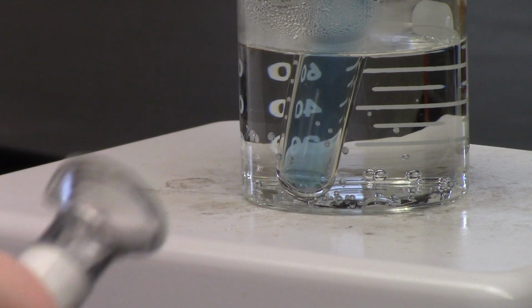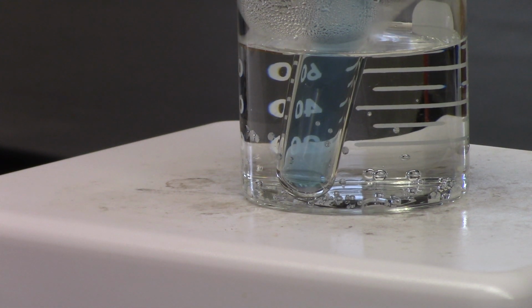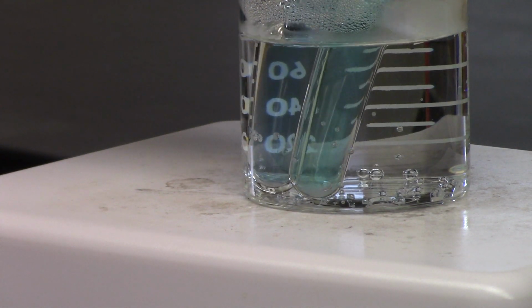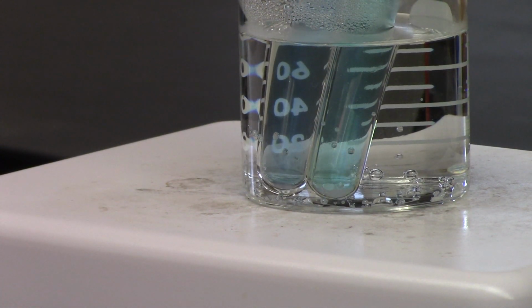That's about a mil. Put it into the water one here. Okay, guys, that's the water. Water and starch together that we heated up for 10 minutes to near boiling. All right, let's put that in there. Here we go. Let's just sit and wait now to see what happens.